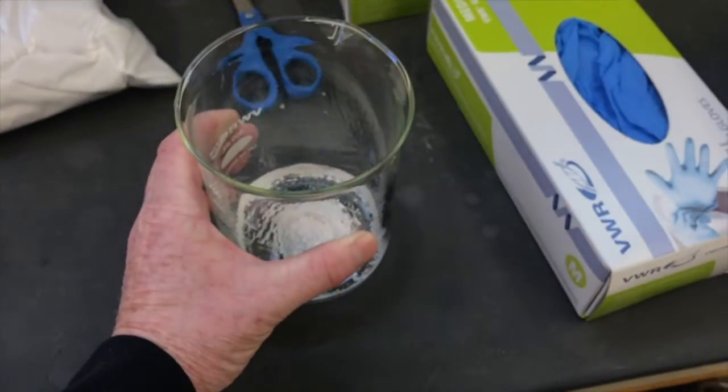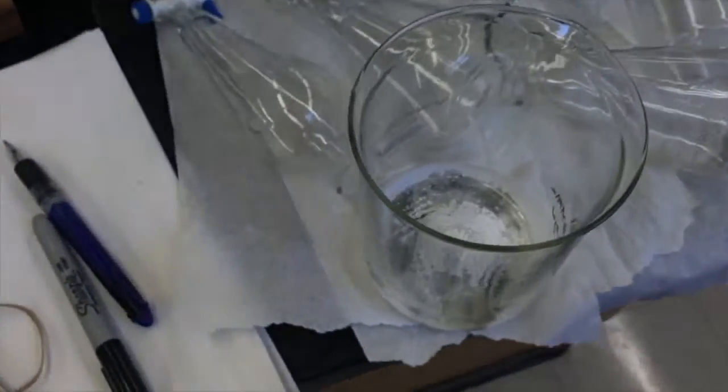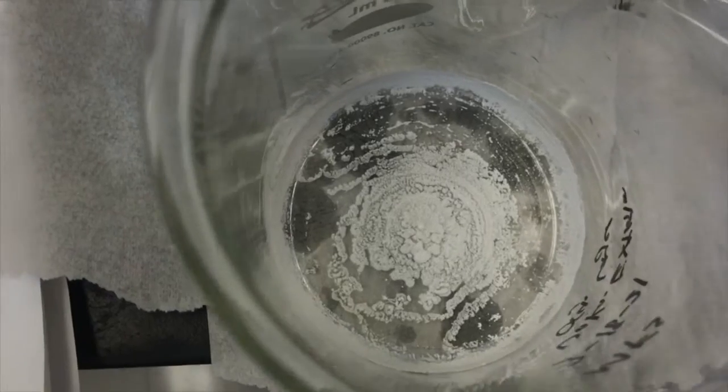Because the dibromobenzene, we're treating that like an impurity. We already know what it is, it's not the unknown. We're going to try to get rid of that via crystallization, and then figure out which molecule we have with NMR and IR.